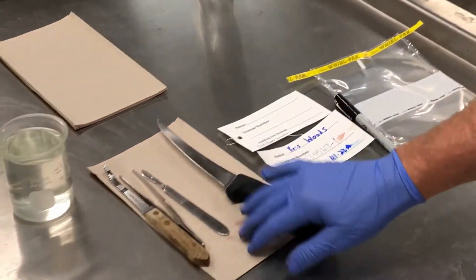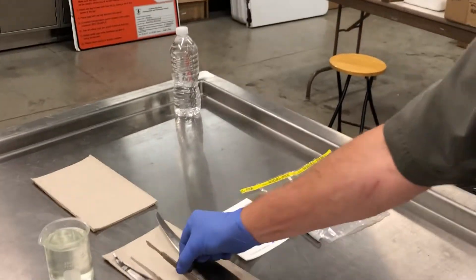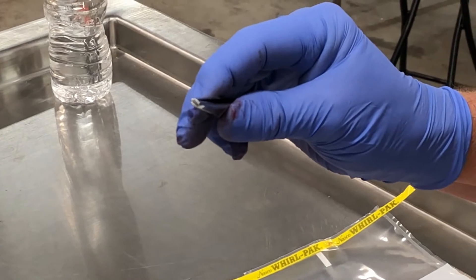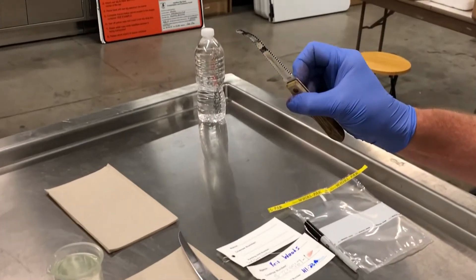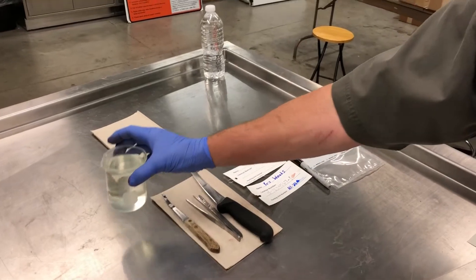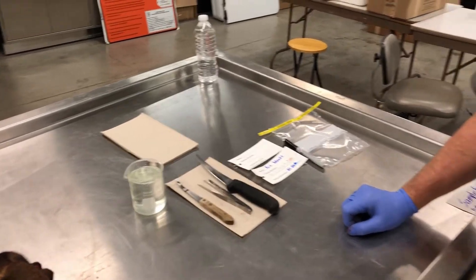Some of the supplies you're going to want on hand: a very good sharp knife, a scalpel, and tweezers — I like the toothed tweezers because it helps grab the tissue a little bit better. I'm also going to show you the grapefruit knife, which is used to pull the obex, but we're not going to show the obex in this video. And we usually have some bleach solution available just to rinse off the utensils as we go.